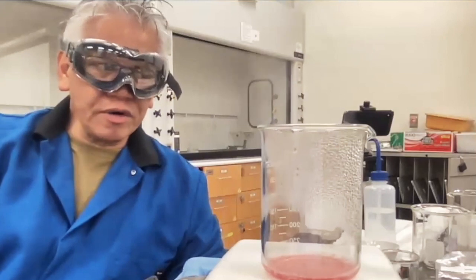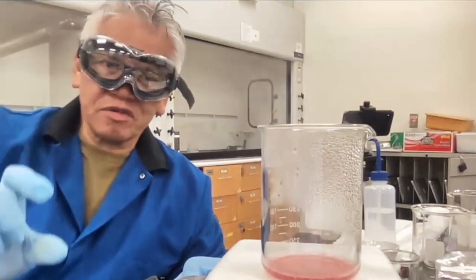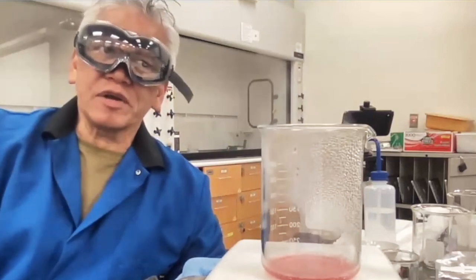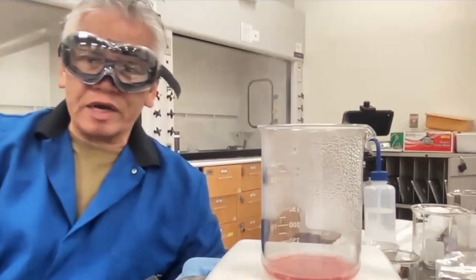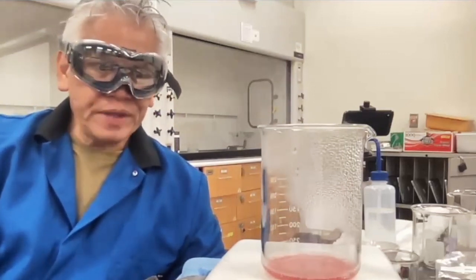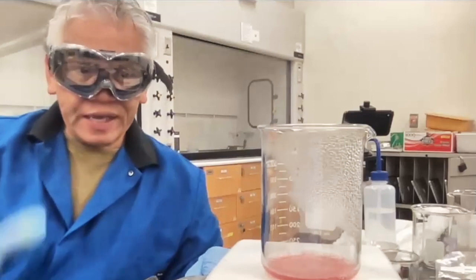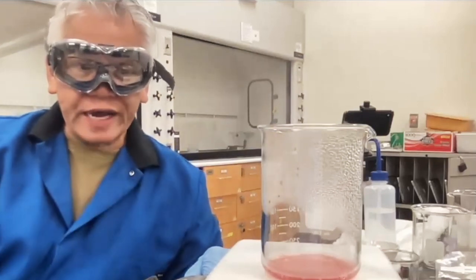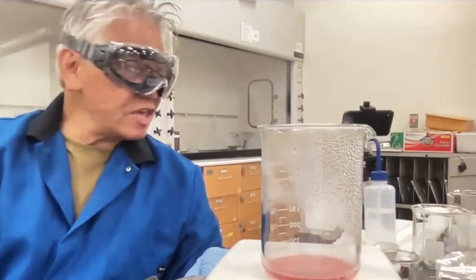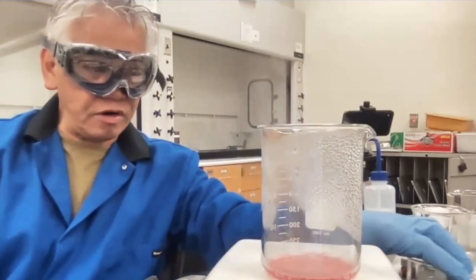And with the alcohol burner, you've got to be a little bit more patient. You've got to make sure it's set up so it's in the hottest part of the alcohol burner, but it's still going to be a while. So that's why you want to use a minimum amount of water. That way it'll go faster. Okay. So I'm down to about maybe 3 milliliters. But again, I'll point out the critical time because I really want you to see the features involved in this particular process, because that's an important part of your observation.